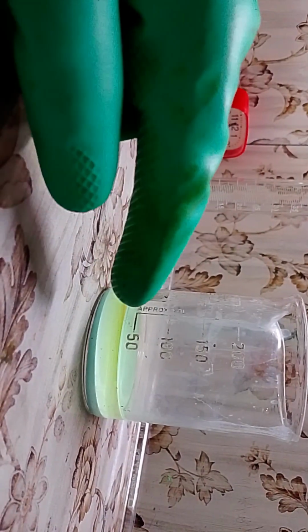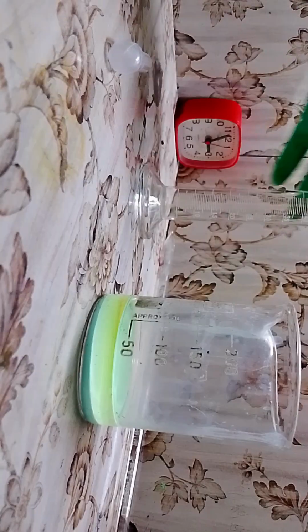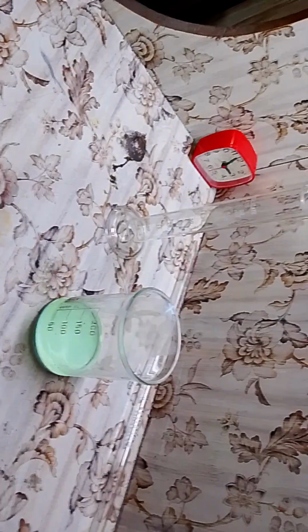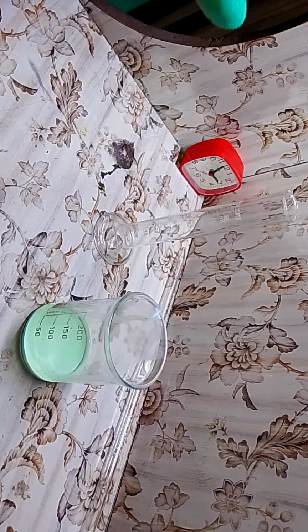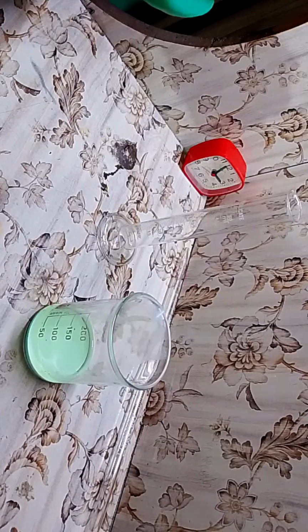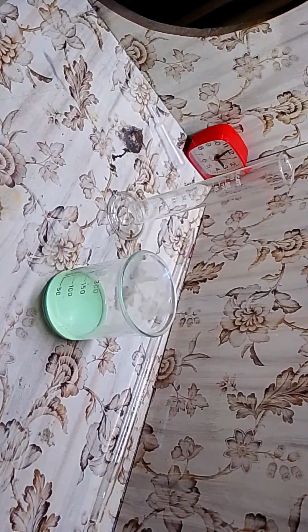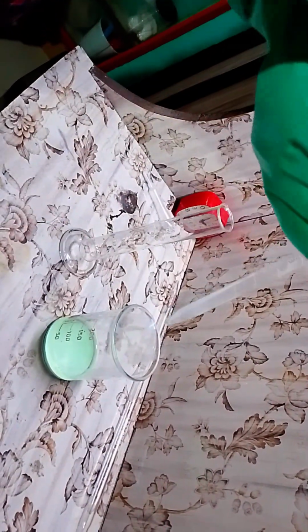Okay, so now we are going to do the reaction. You can see, we are going to extract it. You can see that there's a lot of yellowness in here, which you will also be able to see in this measuring cylinder as soon as we extract it. So let's start. I could use my glass dropper, but it is a little dirty and I don't want to contaminate this. So I'm going to use this one. This is also fine. This is my trusty glass dropper. Now let's start taking the sulfuric acid inside this jar.